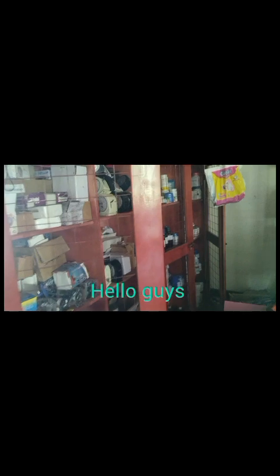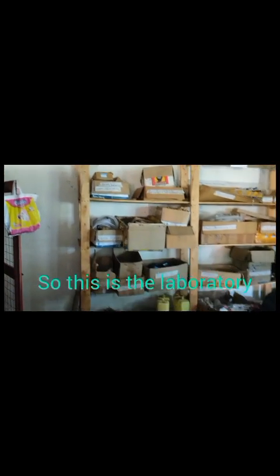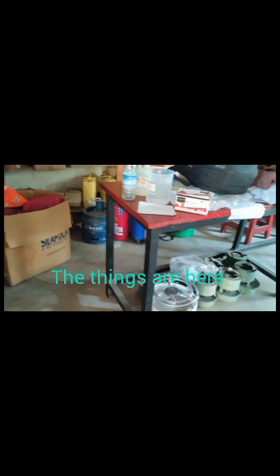Hello guys, this is Science Laboratory from Opwa Community Secondary School. Today we are going to make a liquid soap. So this is the laboratory that we are going to make it in, and the things are here. So these are the materials.